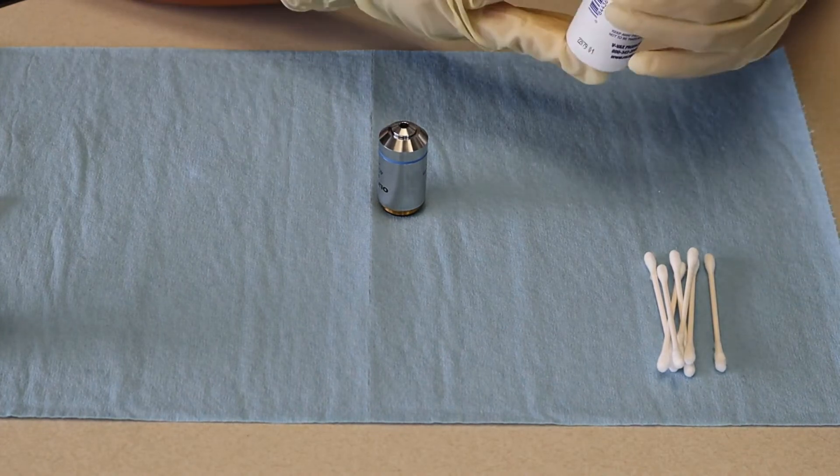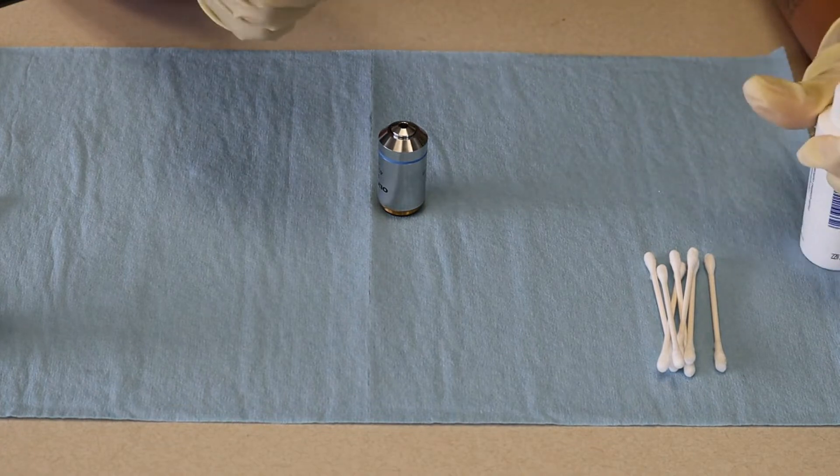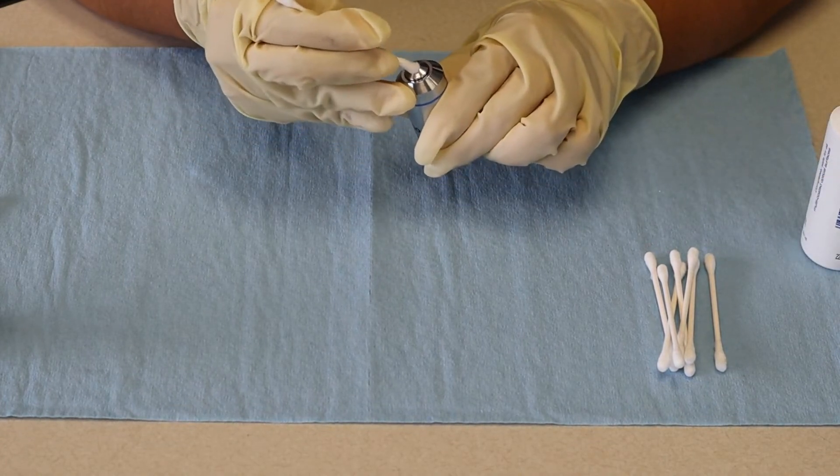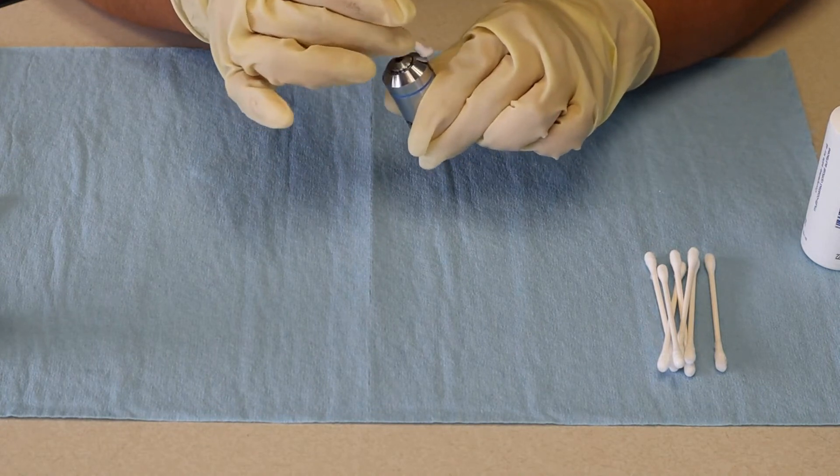It will be the same procedure. Just get your lens cleaner here, get that a little wet and start with the objective here in circular motions.